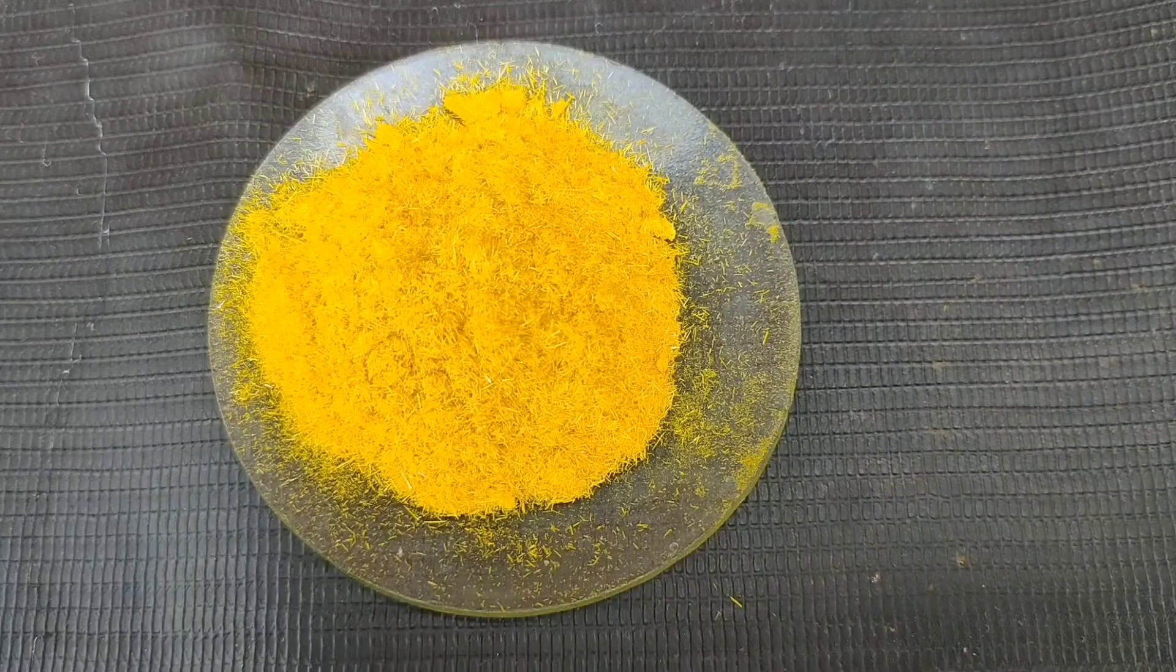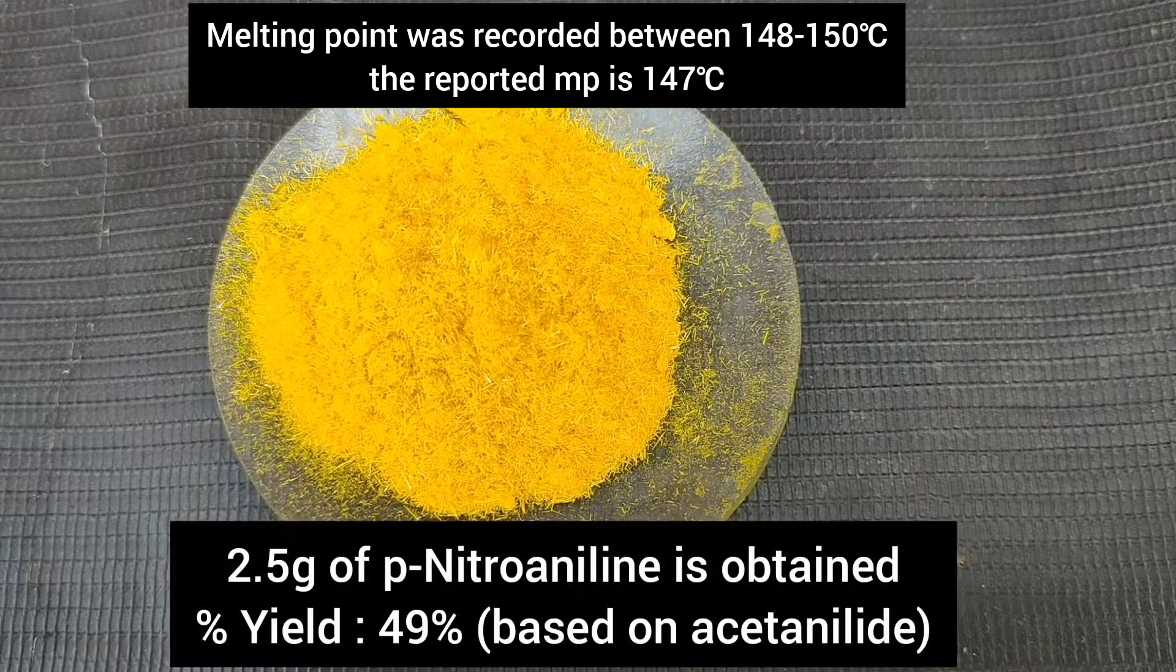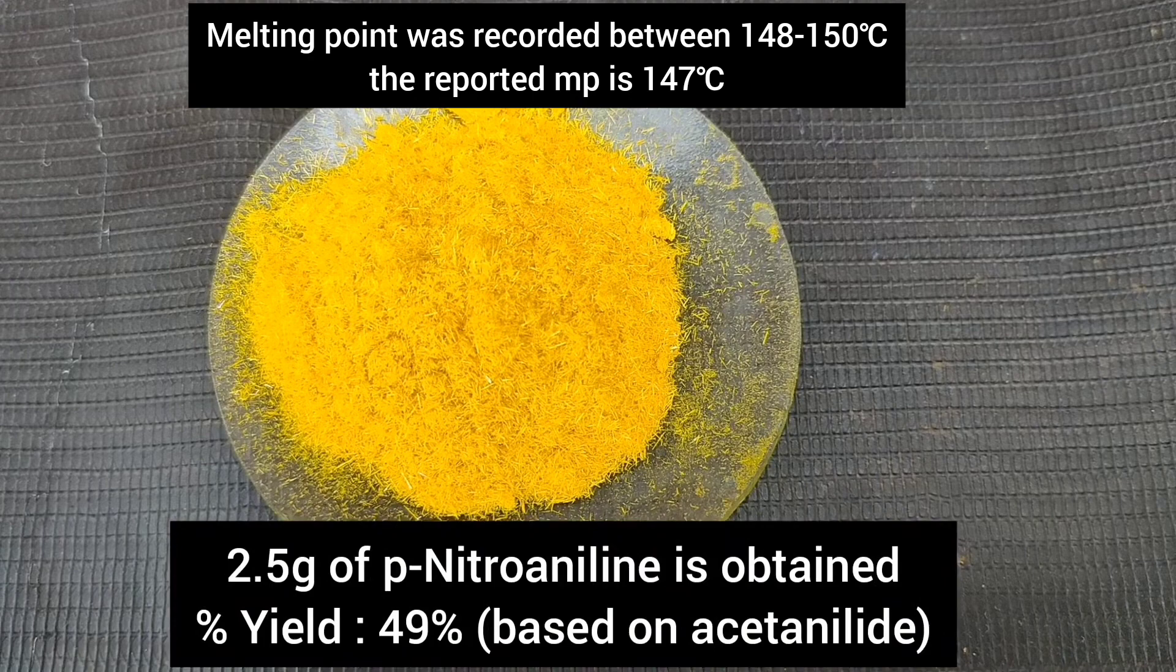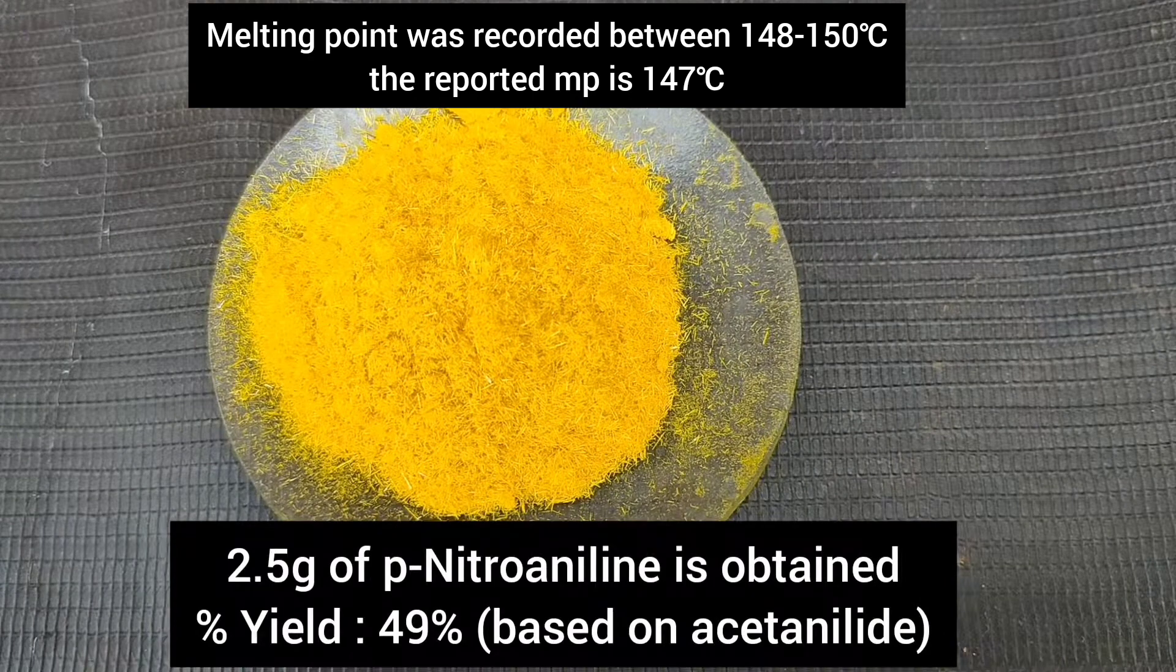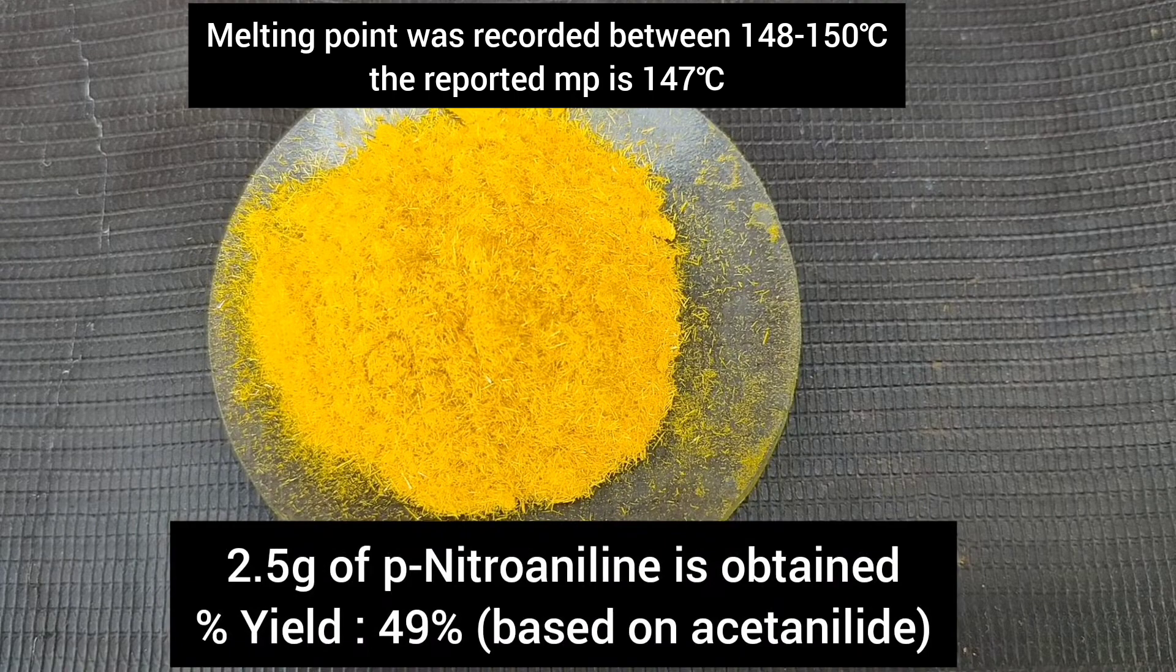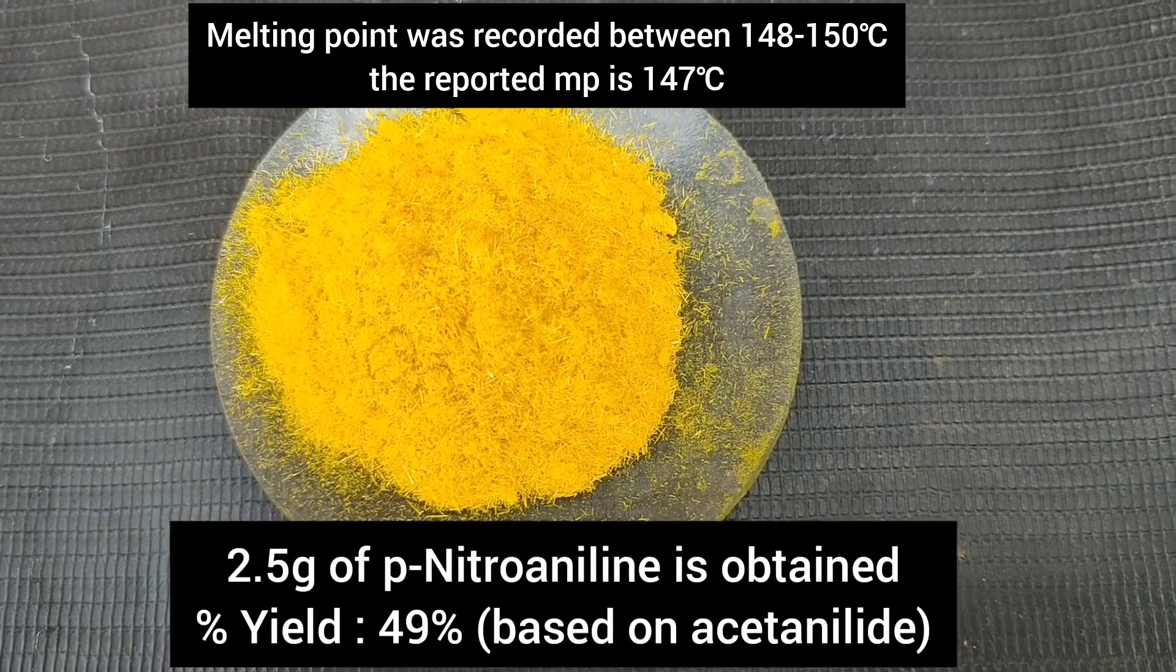The crystals were dried, and the final yield was 2.5 grams, which corresponds to a percentage yield of 49% based on acetanilide. The yield was decent enough.